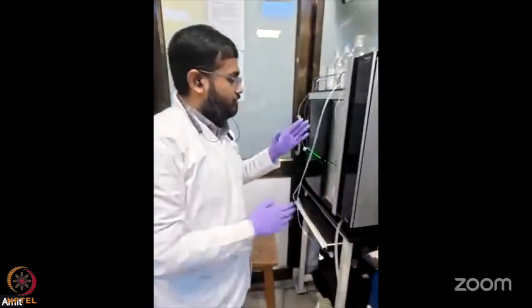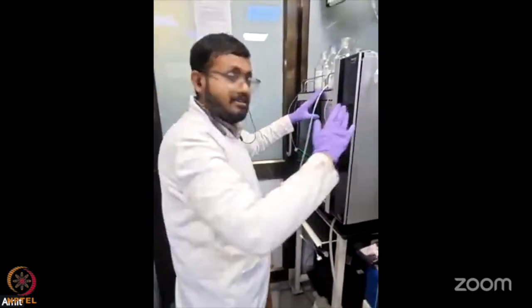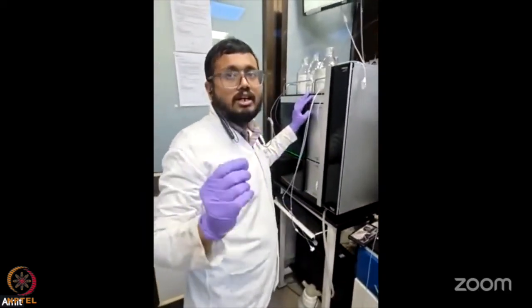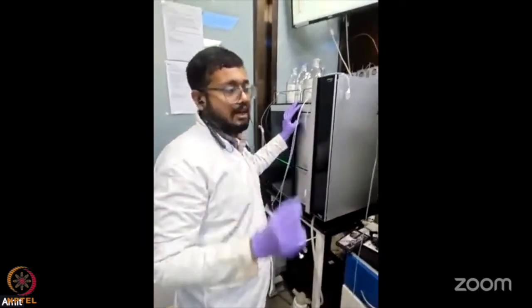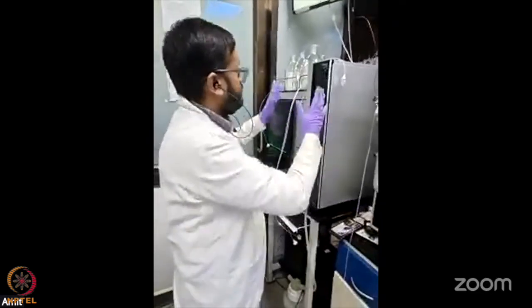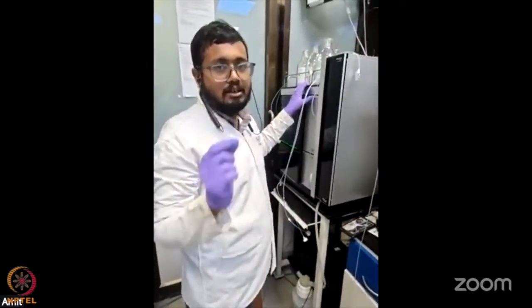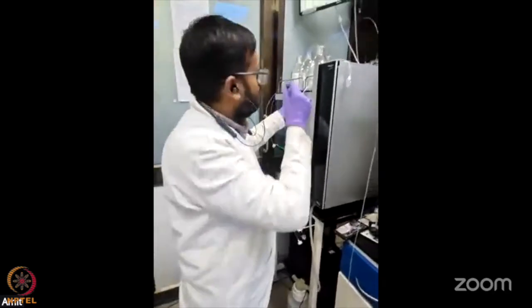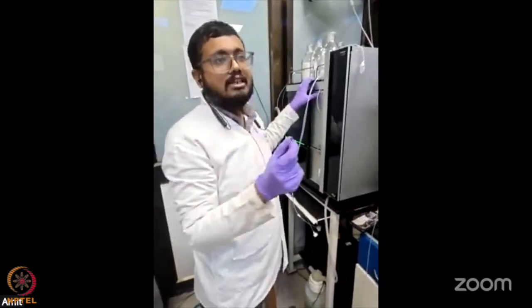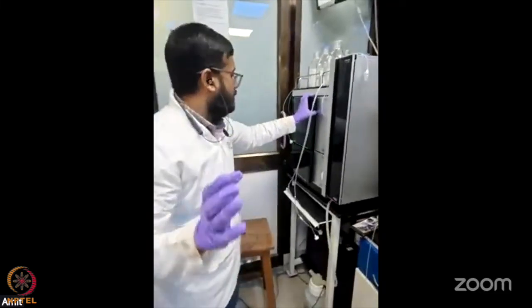So what we are coupled with is the HPLC. The main difference between nano LC and HPLC is the flow rate. With HPLC we get flow rates in mL per minute, whereas in the chromatography I have shown, we need nanoliter per minute. Since we are just going with a few target peptides and target metabolites or lipids, we use a high flow rate so that we have a shorter gradient, use less solvent, and can get accurate quantification of those particular peptides.